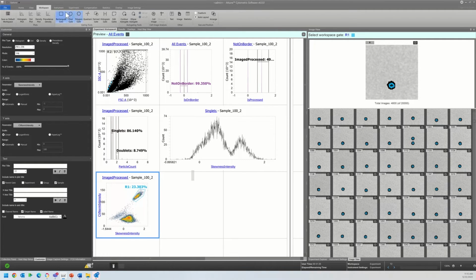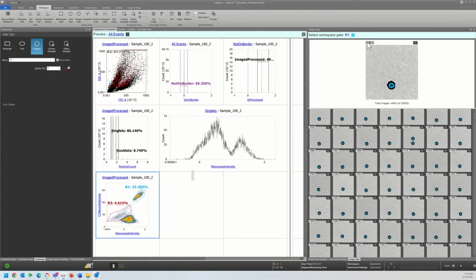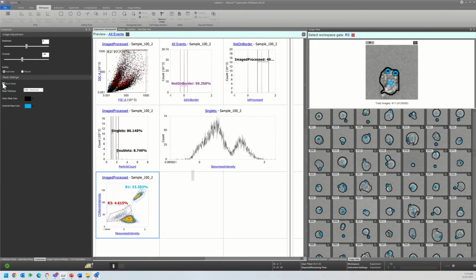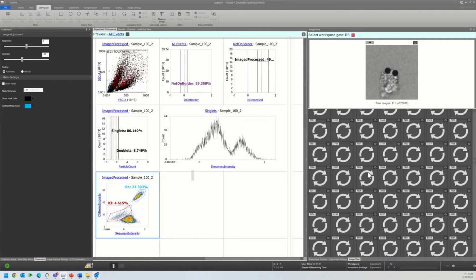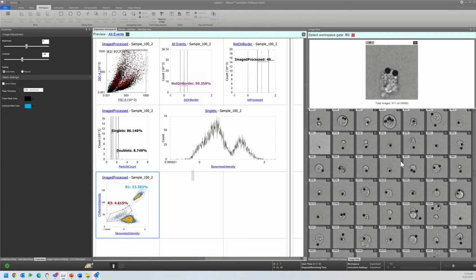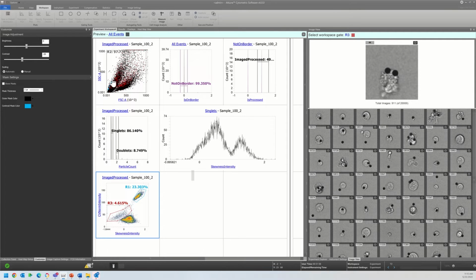And if we look over here, my guess is these are debris, cells on beads, because they're at the midway point between the majority of the population and the beads. And let me turn the masks off to show you. And here we go. Cells and beads, or cells and debris attached to beads. As you can see, this is spread throughout the sample. Almost every event in here is attached to a bead, so that means that most of these events here include a bead in the majority of the sample.